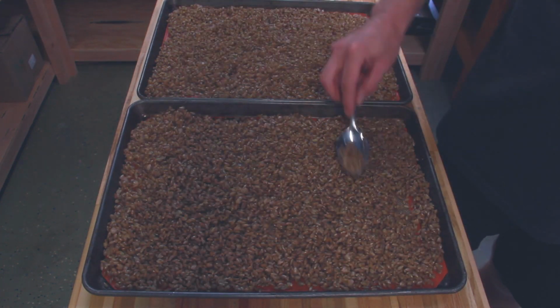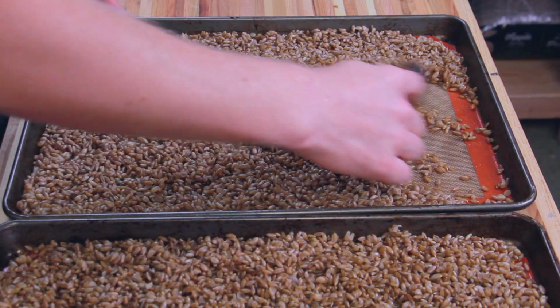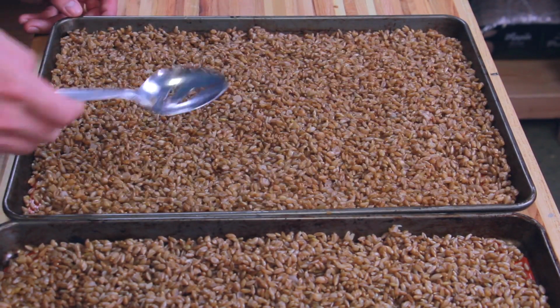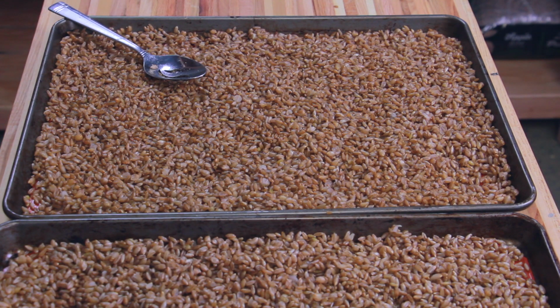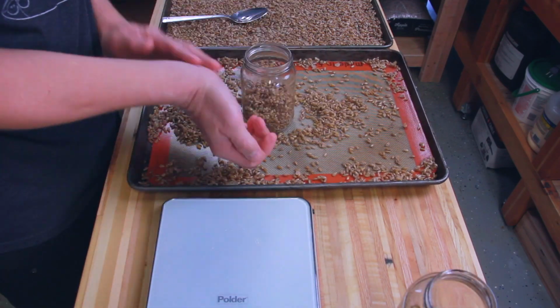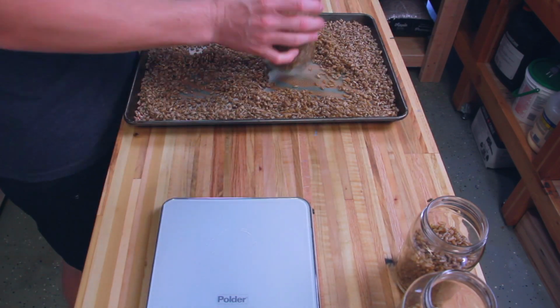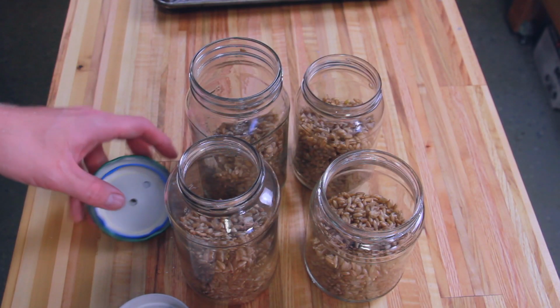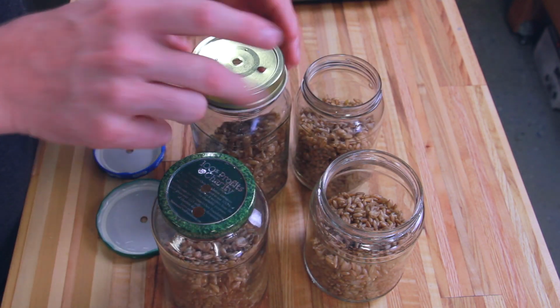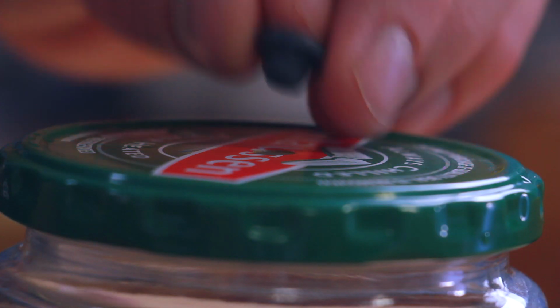I poured it out onto baking sheets and let it dry for about an hour. Halfway through I mixed it just to get all of the grain dry. What we're looking for is at the end the surface of the grain to be dry. After the grain was dry, I tried to evenly distribute it through the remaining 4 jars, but it turns out that I had way more grain than I needed. So I ended up taking some of the extra grain and putting it into a couple other jars and using that for a lion's mane project that I got going on.